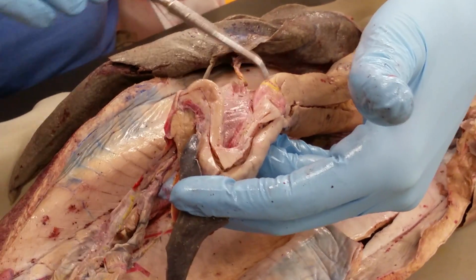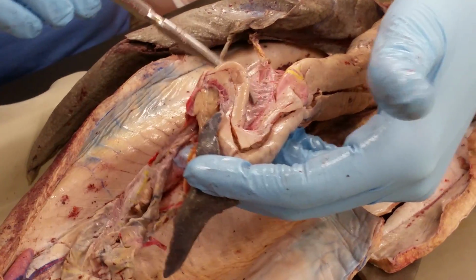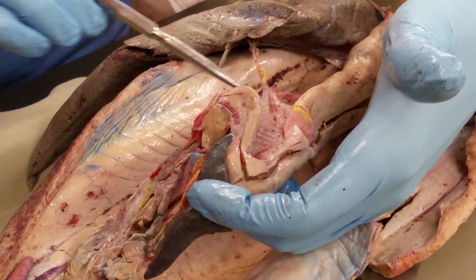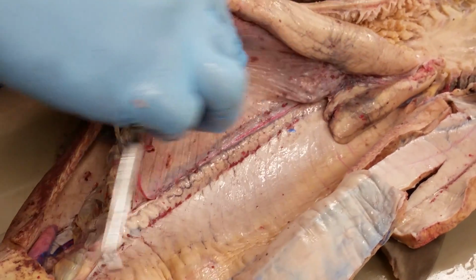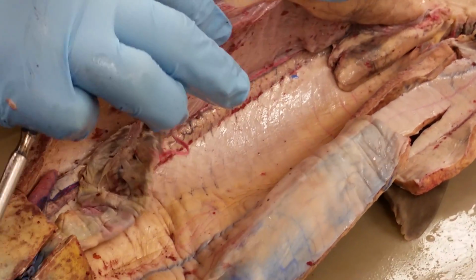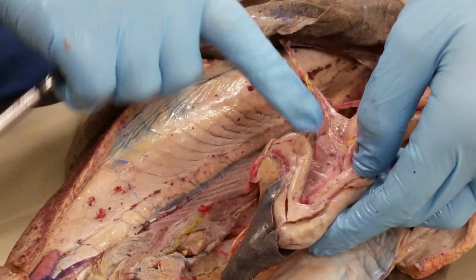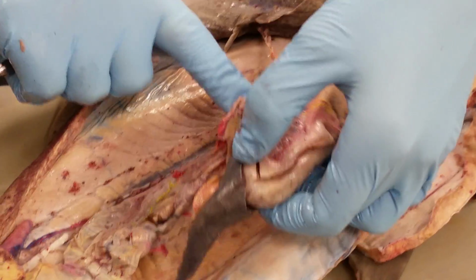The part coming from the stomach and going to the liver is gastrohepatic ligament, and this sheet going over here to our duodenum is the hepatoduodenal ligament. The mesentery holding up the stomach here, on the greater curvature side of the stomach, is either called the mesogaster or greater omentum. Okay, whereas this is the lesser omentum with gastrohepatic ligament and hepatoduodenal ligament.